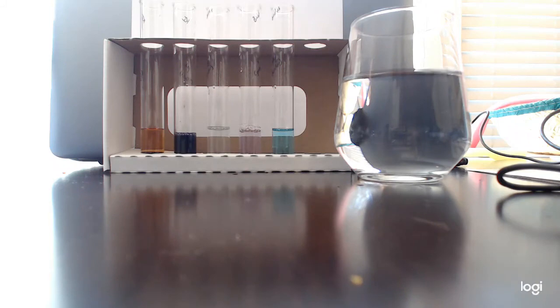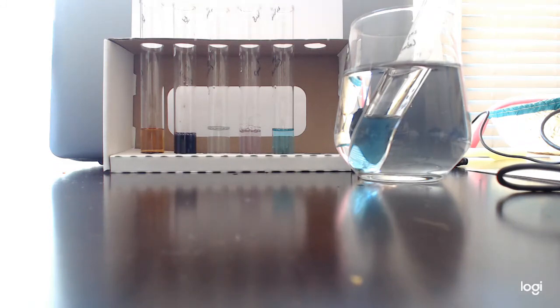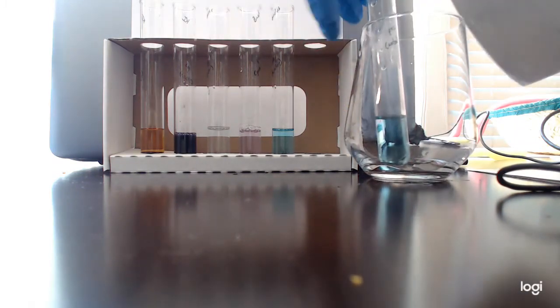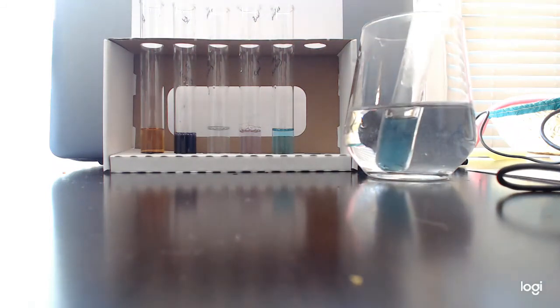Maybe. Oh! Yeah, kind of at the bottom. All right, let me get some boiling water. That way it'll be more obvious. All right. Let's clear this out. We're going to get the real hot water, and hopefully that will help the color change. This is easier in a lab for sure. Ready? 1, 2, 3. Okay. Now we'll wait.